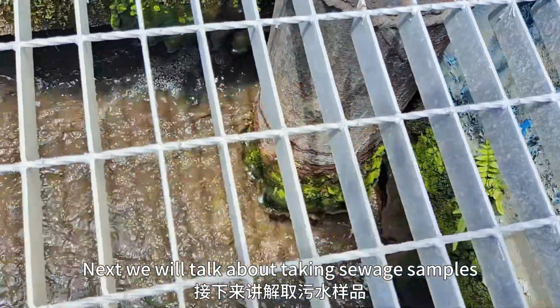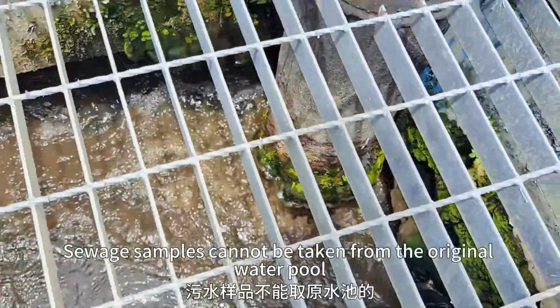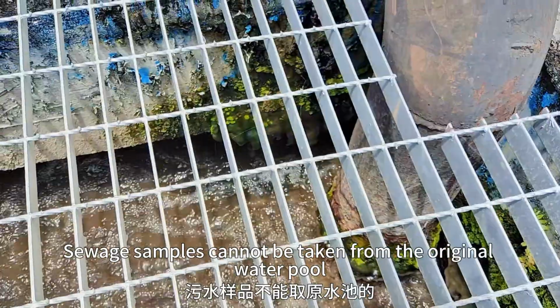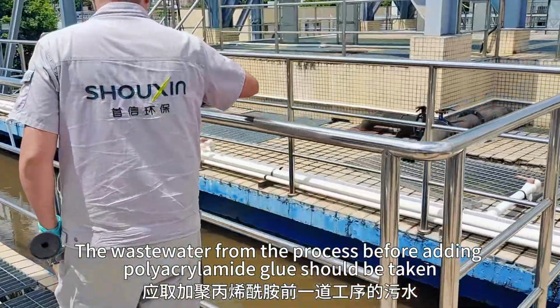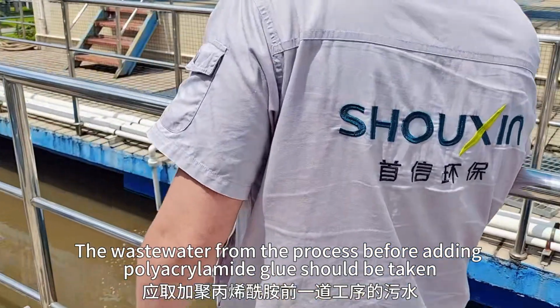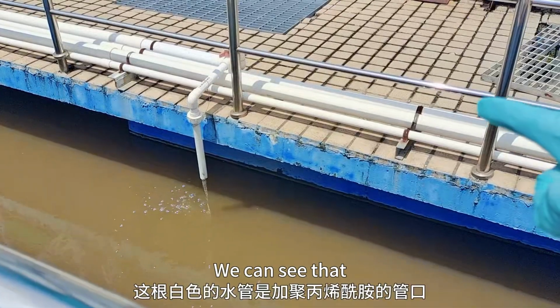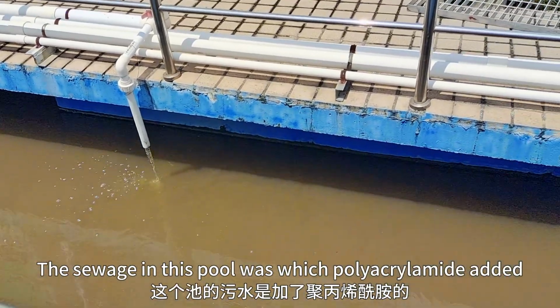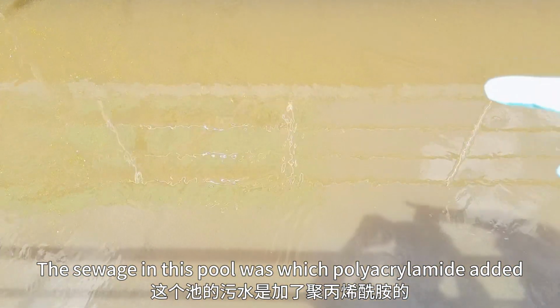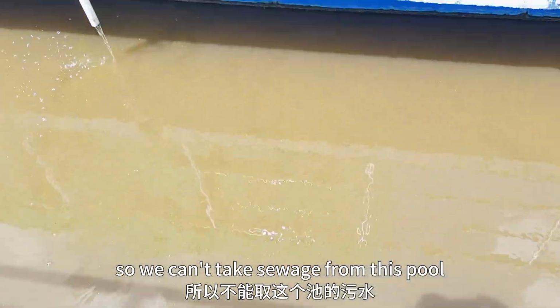Next, we will talk about taking sewage samples. Sewage samples cannot be taken from the original water pool. The wastewater from the process before adding polyacrylamide should be taken. We can see that the white water pipe is used for adding polyacrylamide. The sewage in this pool has had polyacrylamide added, so we cannot take sewage from this pool.